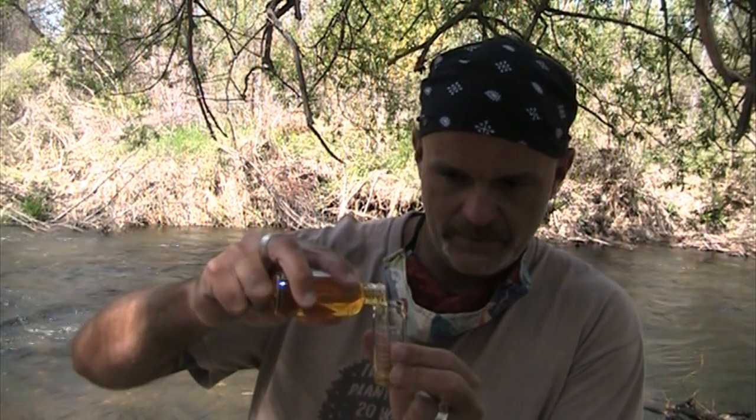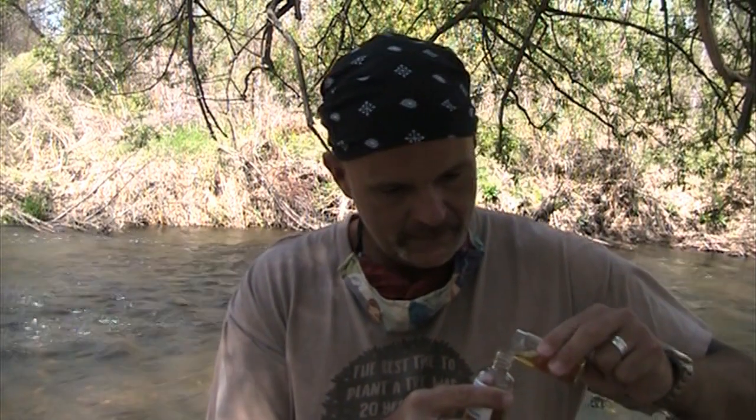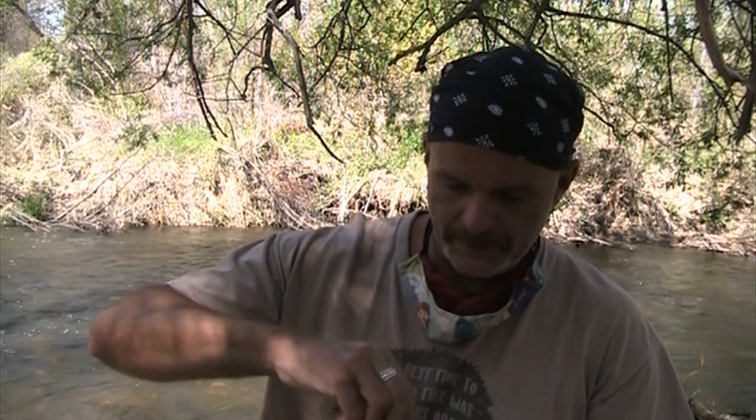So, what I'm going to do, and in the classroom I would have them do this over the sink. I'm carefully trained, but I would not recommend doing this in the field with your students. For students, we wouldn't do this in the field. I'm going to add 20 milliliters exactly without spilling any of this into the environment. There's meniscus at 20 milliliters. And I'm going to do a titration.